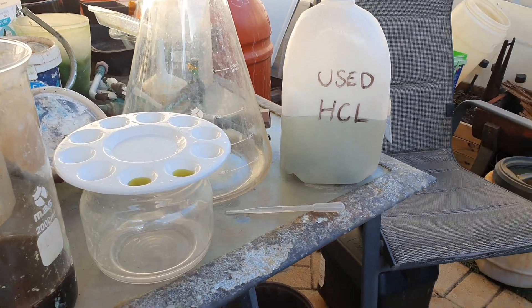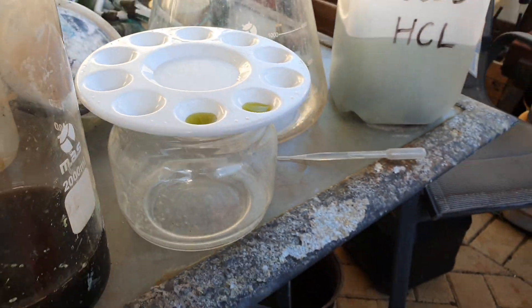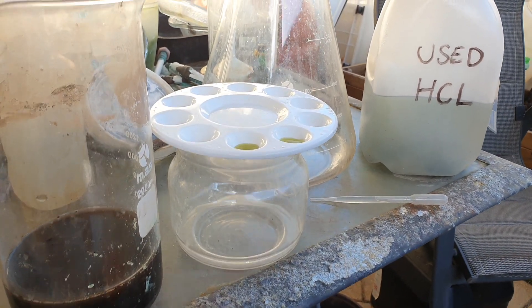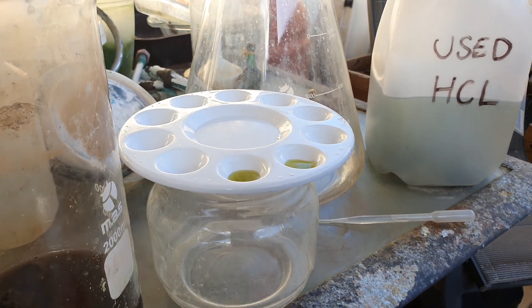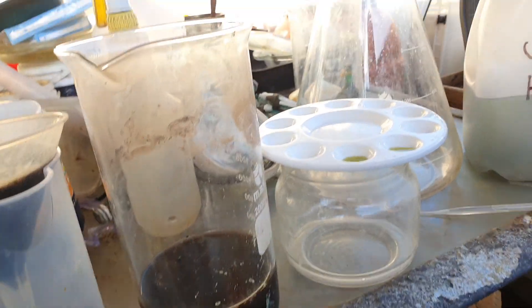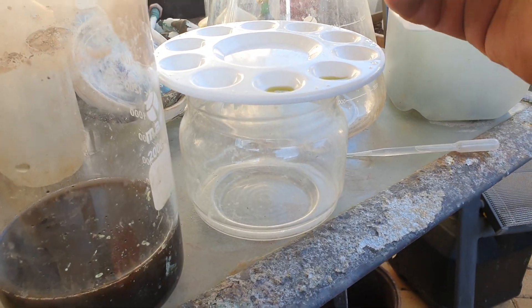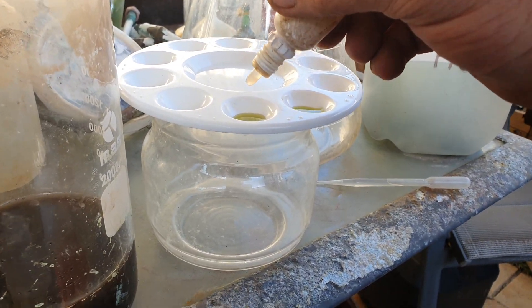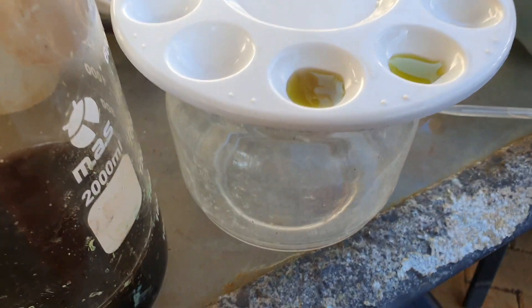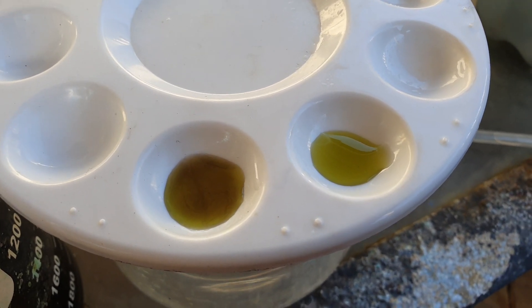So we're going to put it to the test. In here I have two known gold samples. It is a very weak solution, so it won't give you a solid black response straight away, but it will give you a positive nonetheless. I'm going to put some stannous chloride into one of them, and you can see it's slowly going dark.